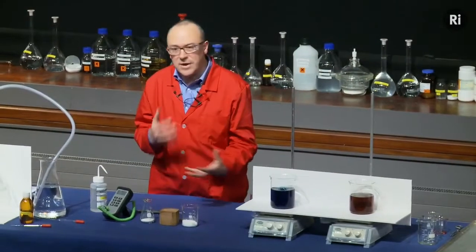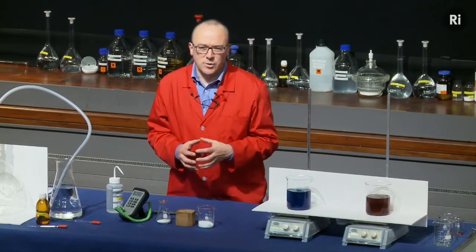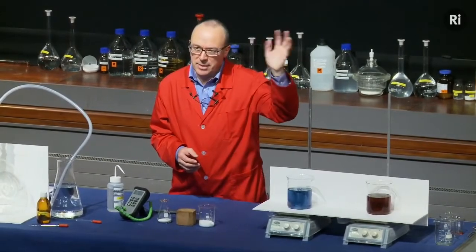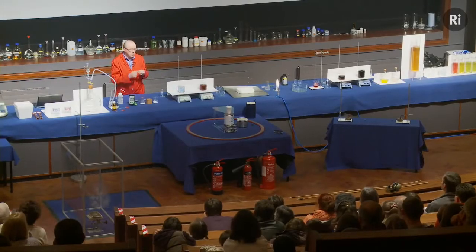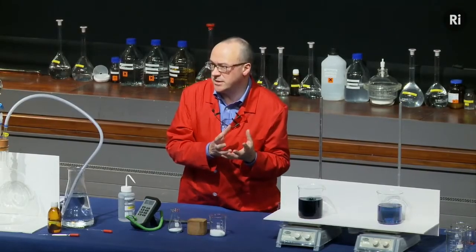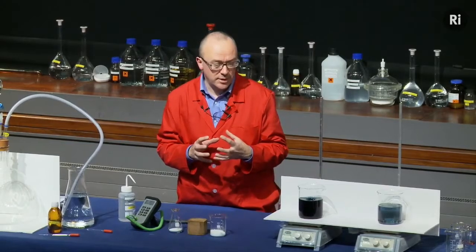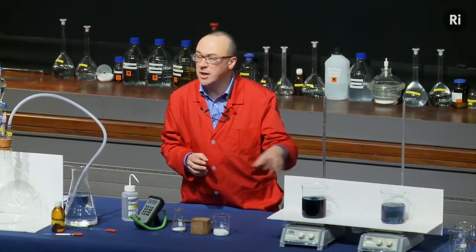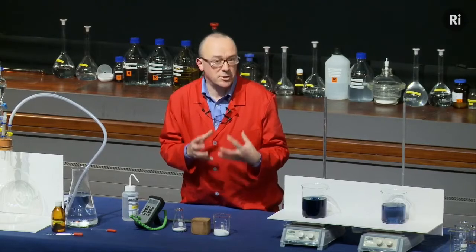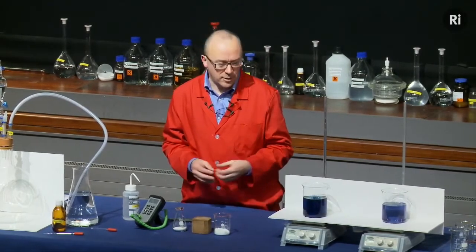So it seems as if we've found a chemical reaction that does actually go backwards. But really that isn't what's happening. It's not like a ball rolling downhill and then changing its mind and rolling back uphill again. It's more like a ball going down a sort of a helix. It gets back to the same colour as when it started, but it's not really in the same condition because some of the chemicals have been used up. And we can watch these oscillations happening, but after 10 or 20 minutes, they will come to a stop. And that's because the chemicals have been used up. So we haven't really found a reaction yet that can go backwards.